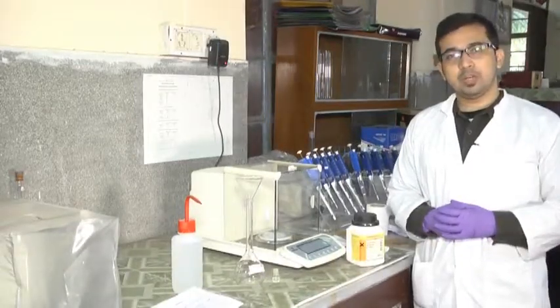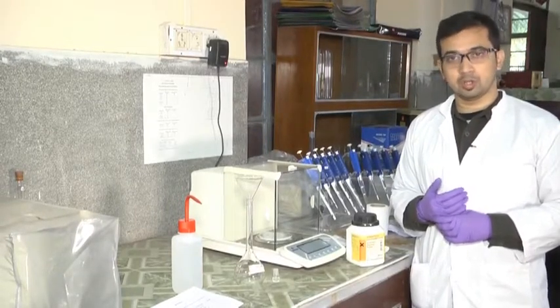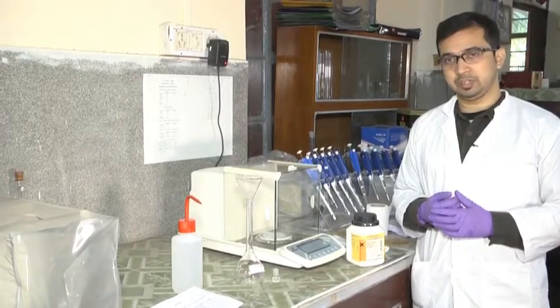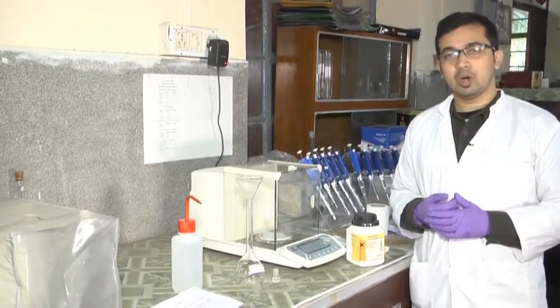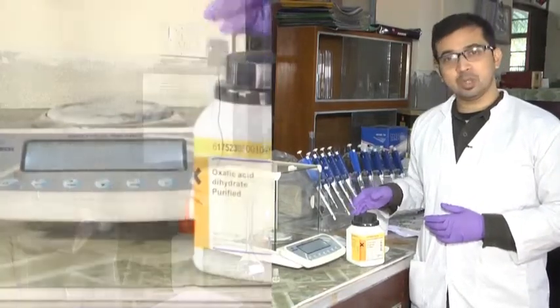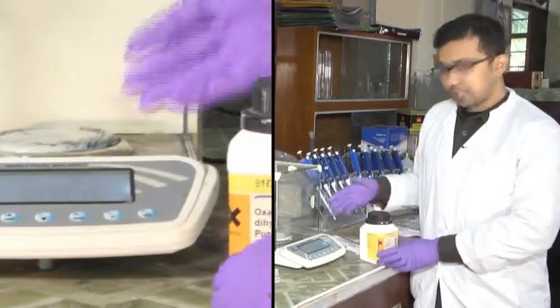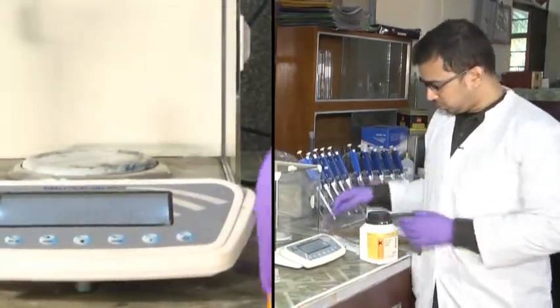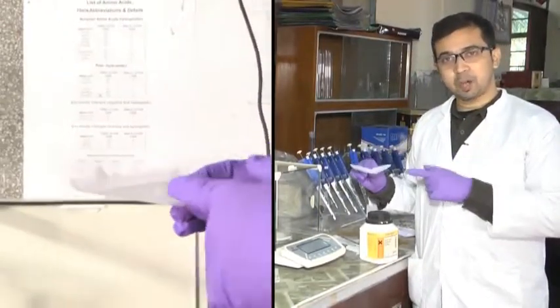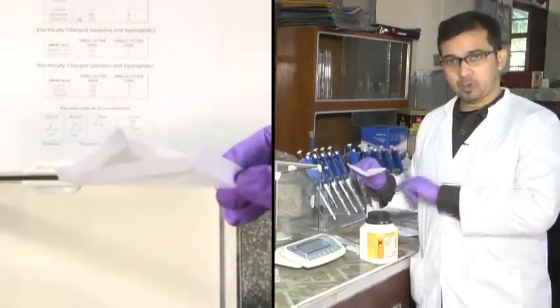Initially we will begin by weighing our oxalic acid and preparing the primary oxalic acid solution. The oxalic acid we will prepare is 250 ml of 0.2 normal oxalic acid. For that we will require 2.25 grams of oxalic acid. This is the digital balance and here is the butter paper — we will put the sample on it and weigh the amount of oxalic acid.